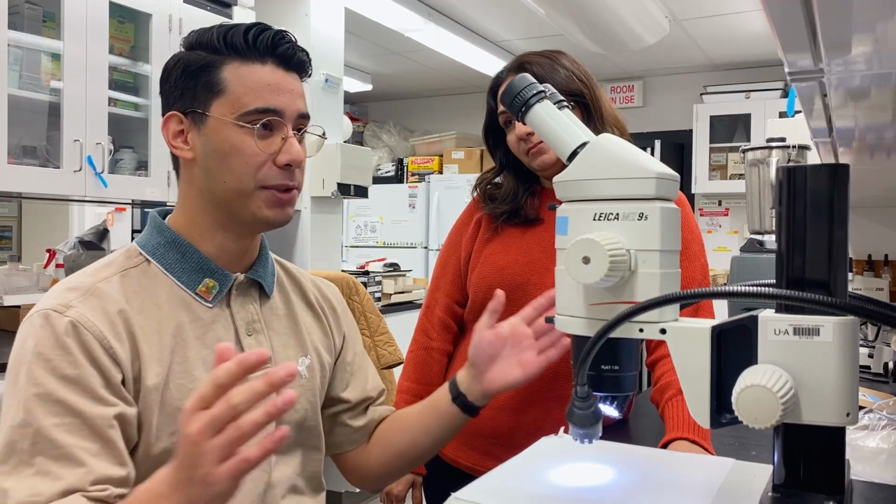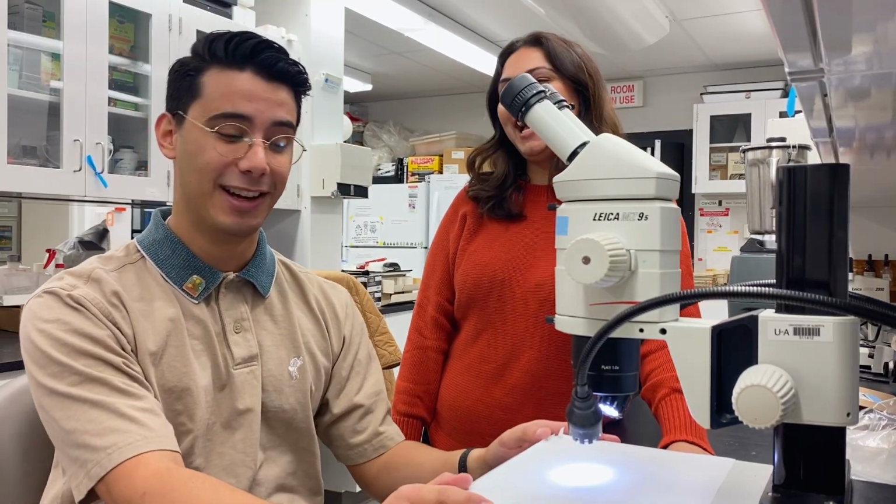We are seeing preference for some plots versus the others. But again, it's hard to say without fully getting all the data and really running the stats. Right now, this is just very preliminary analysis. And after hours and hours of this microscopy work and identifying all of them, you're going to go sit in front of a computer and punch in your data. Yes. And then put a statistical program to analyze what actual differences you saw. Yes, exactly. You go from staring into this to staring into something else. Unfortunately, that's how it goes sometimes.